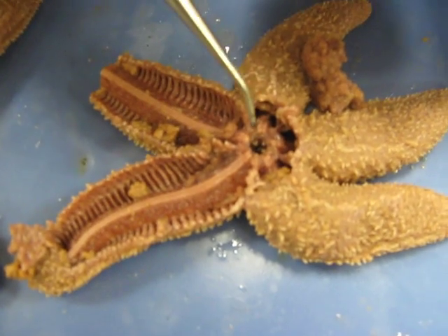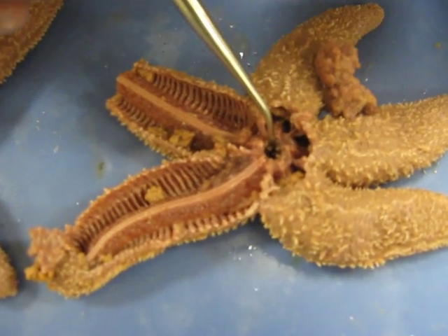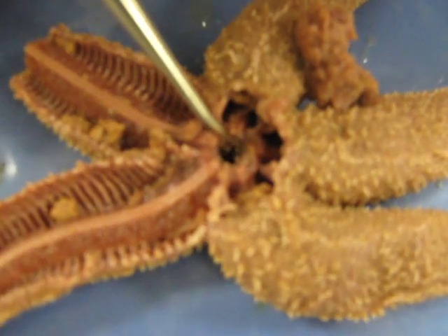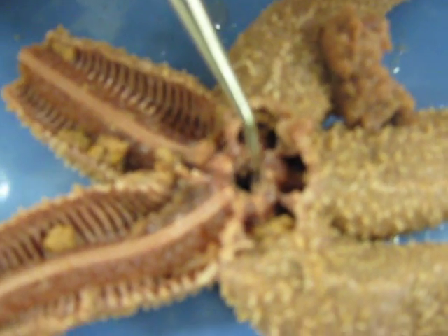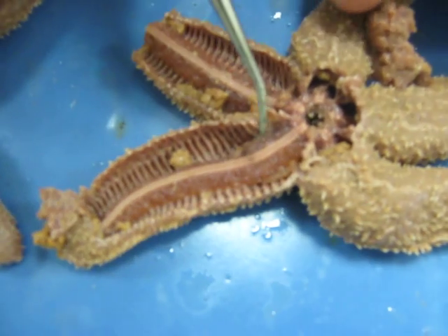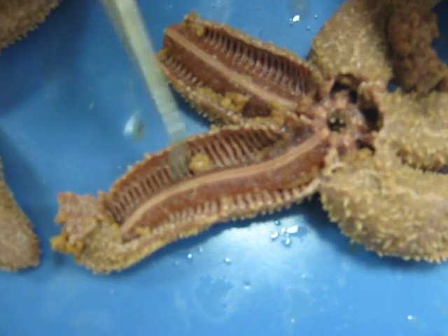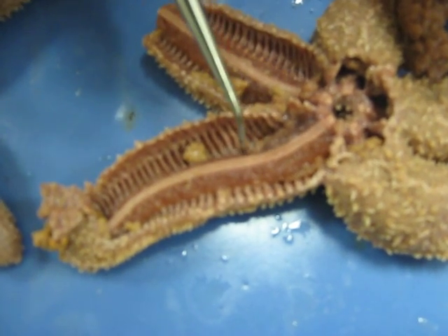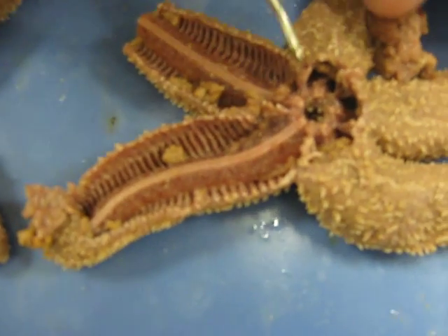This is the circular canal. Inside you can't really see the polian vesicles, but the Tiedemann bodies are these brown spots right here around the circular canal. And then down the arm is a radial canal with ampulla — this gelatinous structure on either side, ampulla. And then the gonads are these stringy structures near the base of the arms. And that's it.